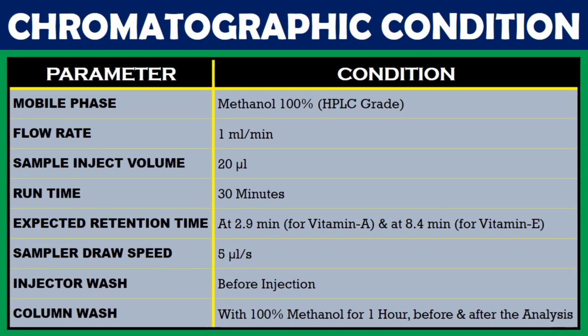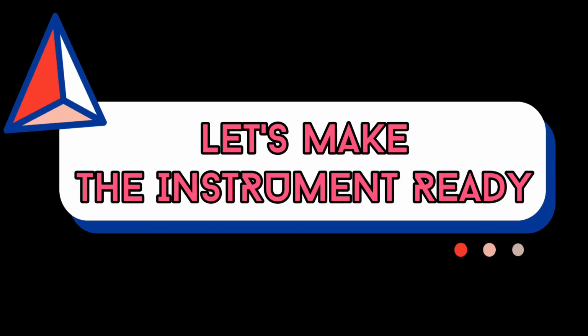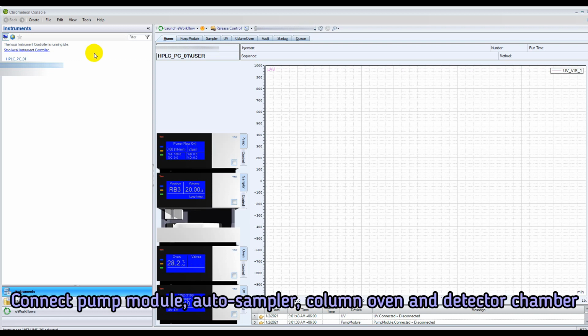Chromatographic conditions are shown in the display. We must ensure these conditions before the analysis of Vitamin A and E. Let's make the instrument ready. Turn on the HPLC instrument and open the data acquisition software in the computer. Connect pump module, auto sampler, column oven and detector chamber.